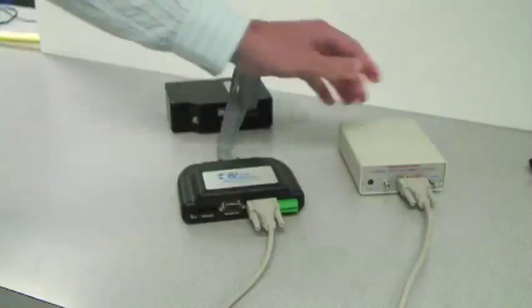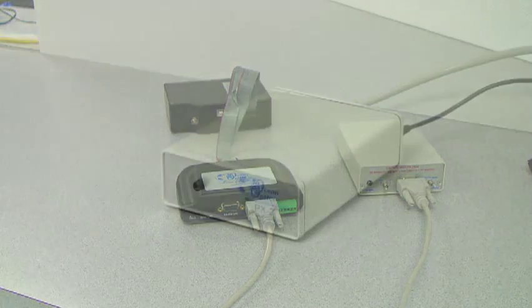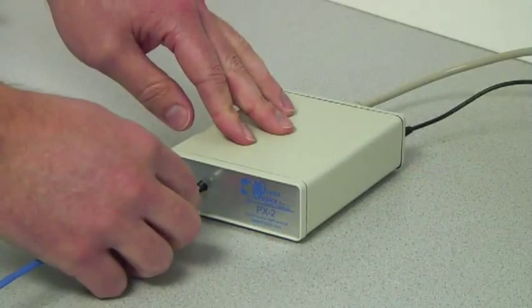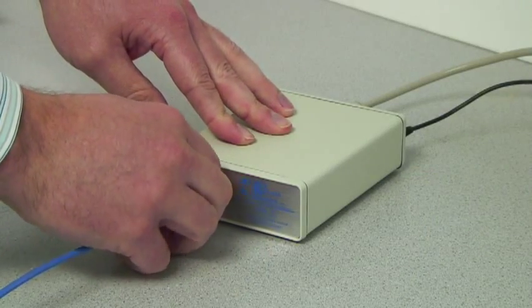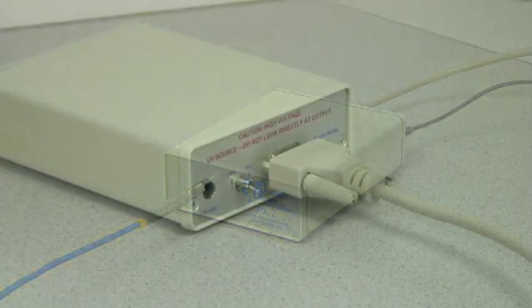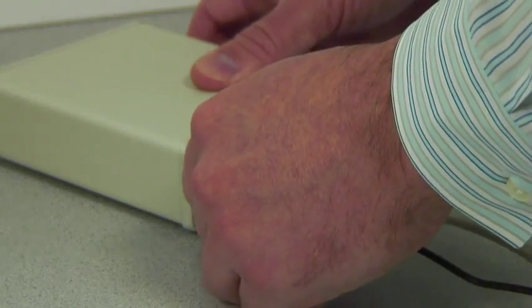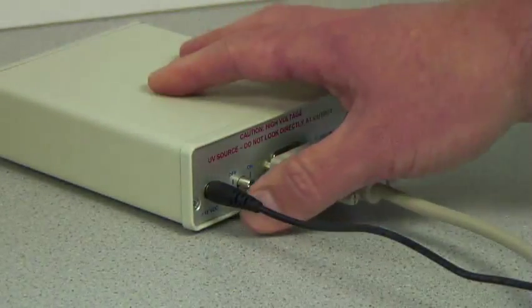Now that you're connected, you'll need to configure the PX2 to operate with your instrument and your system software. First, connect the PX2 to the rest of your experiment by attaching the optical fiber to the SMA905 connector on the front panel of the PX2. Next, turn on the PX2 using the power switch on the rear of the unit.